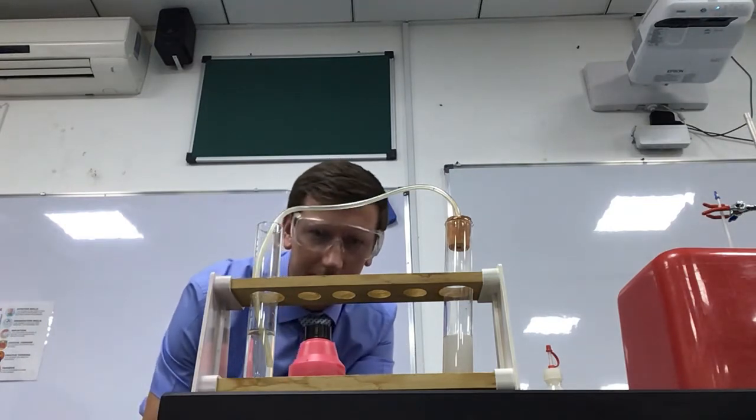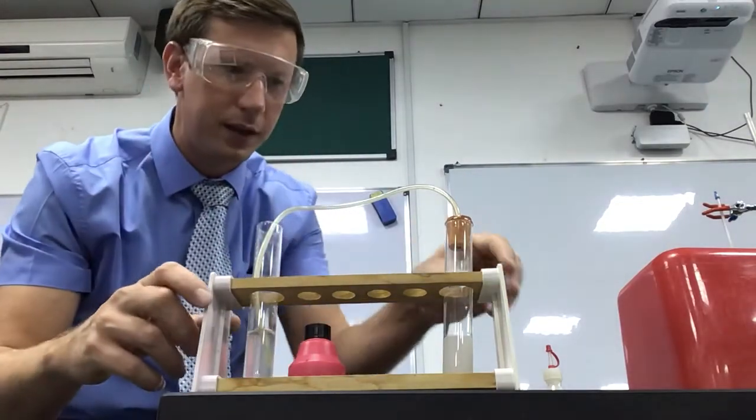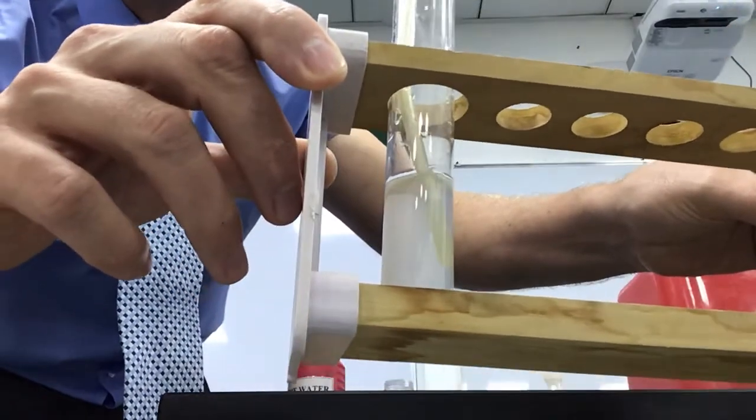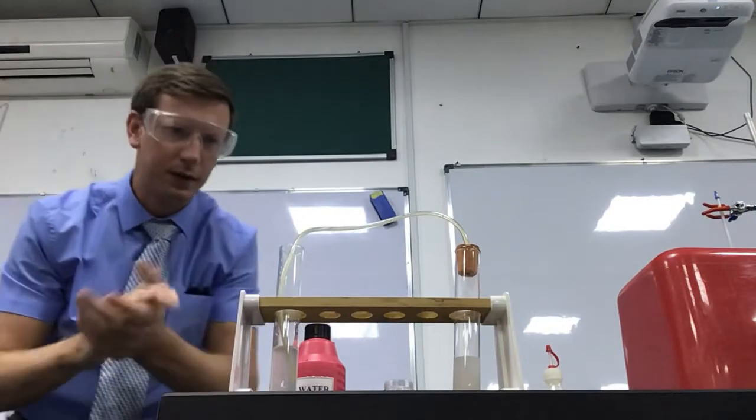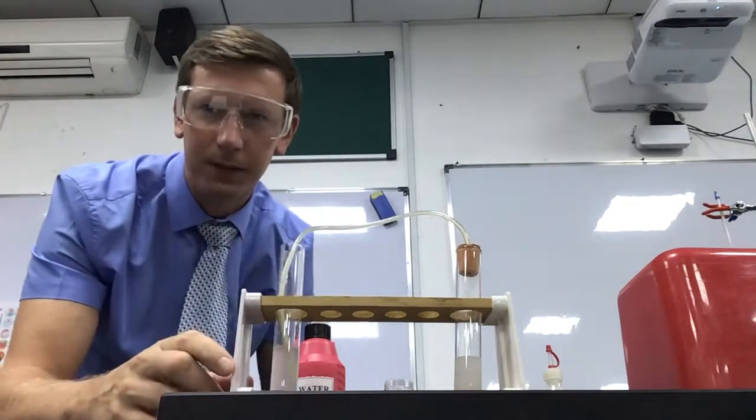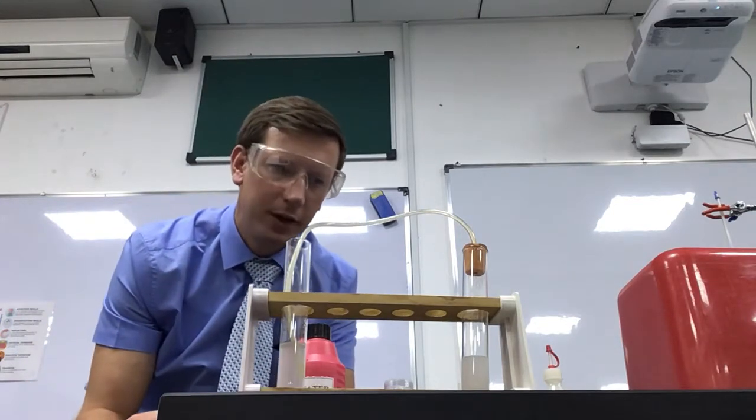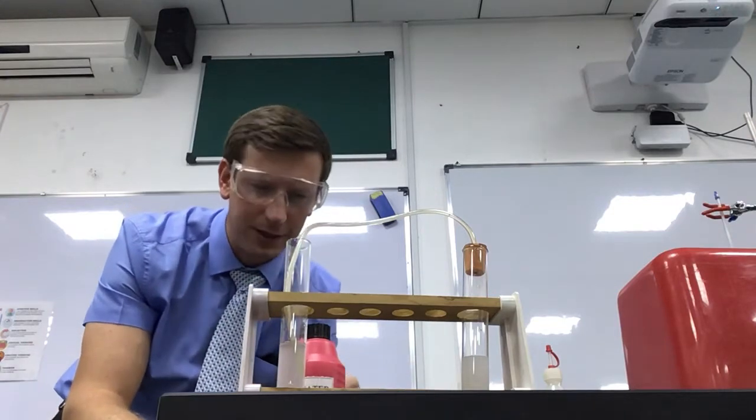So the liquid is no longer clear. It's turned a little bit cloudy. I don't know if that's particularly visible. So there we go. In fact, it's turning cloudier as we go. That has shown us that the magnesium carbonate and the sulfuric acid have reacted.